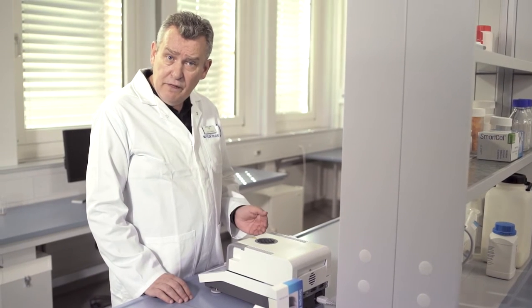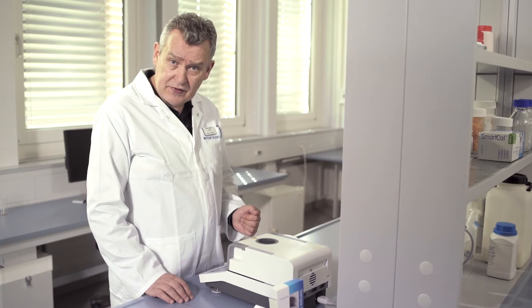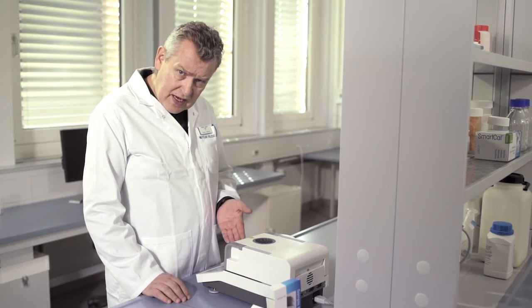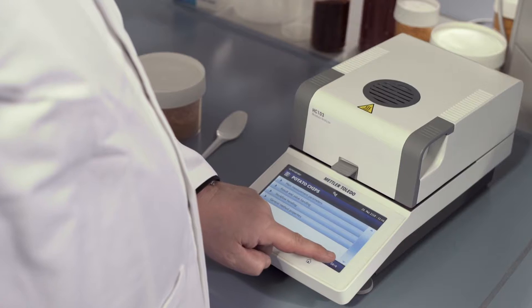Now, we can define the method parameters, but in this case, let's use the standard settings and just press Save.